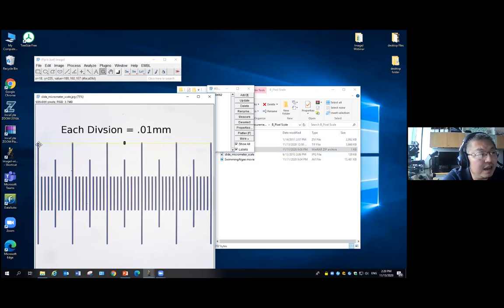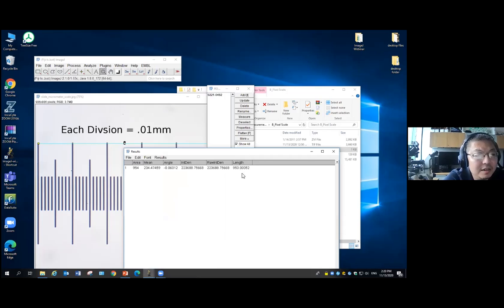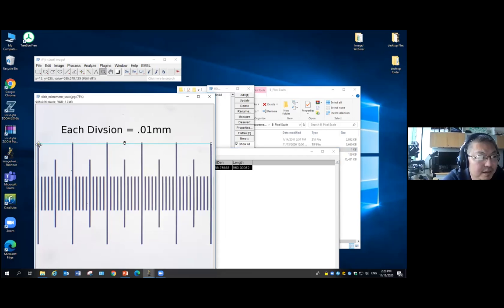I will draw a line from here to here, and I'm going to measure the length of this line. Just click measure here, and it will give you the length of this line. And what is the unit of this number now? As we know, it's pixel. It's how many pixels from this to this.